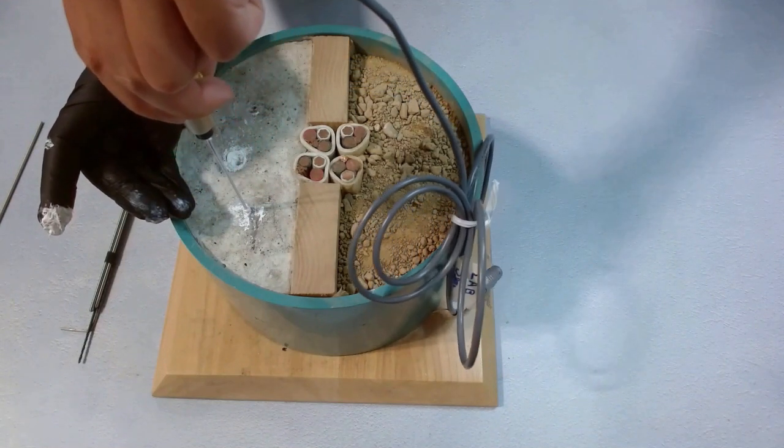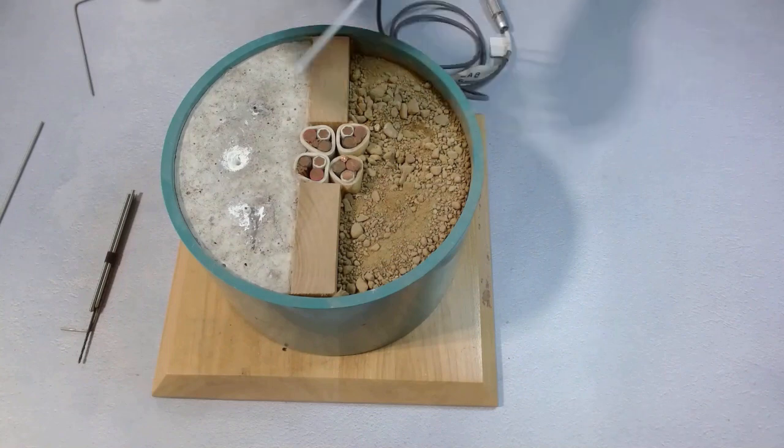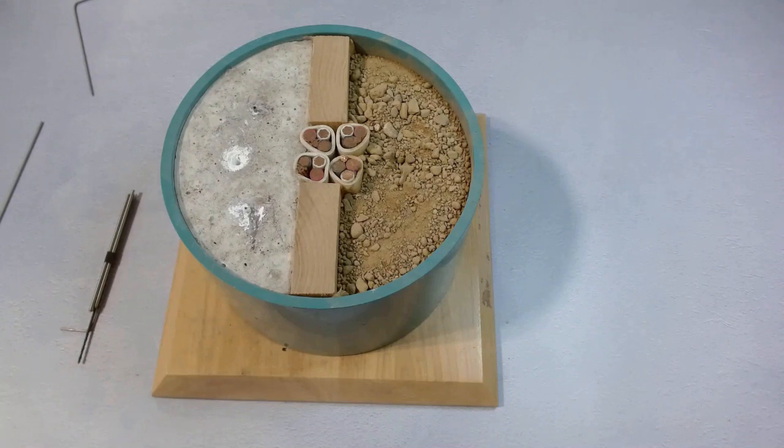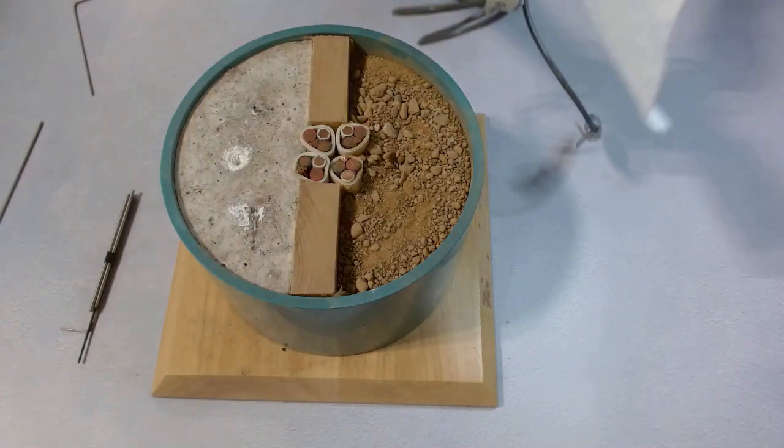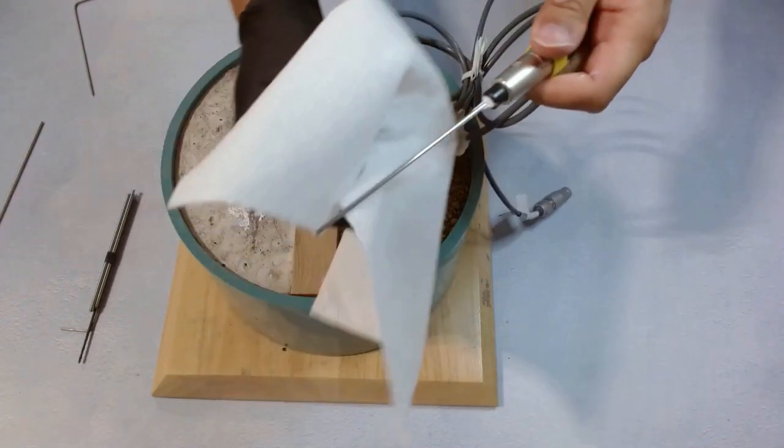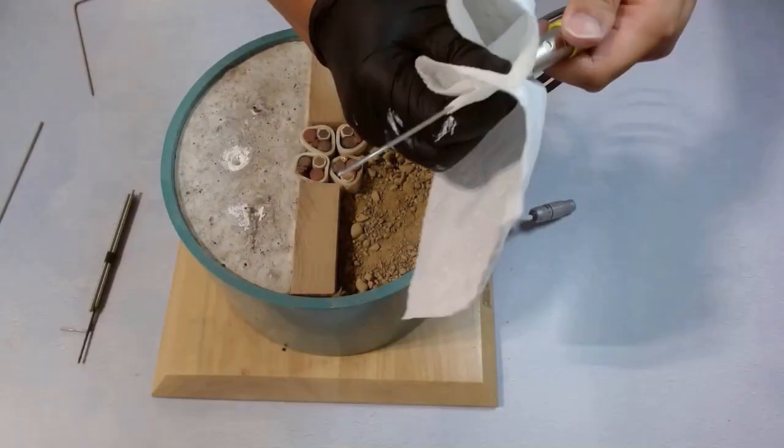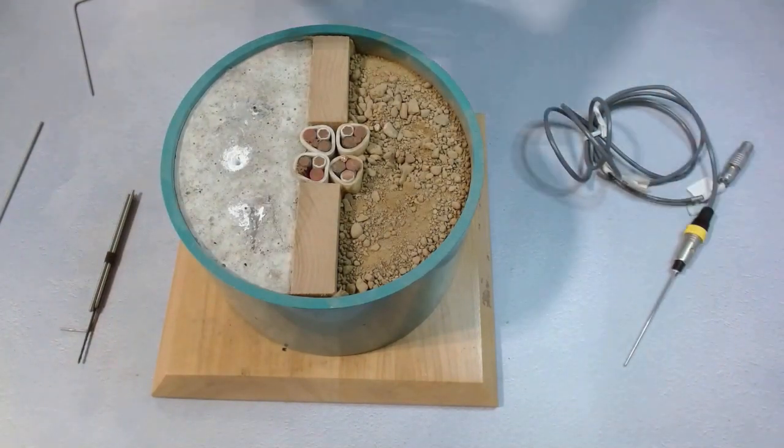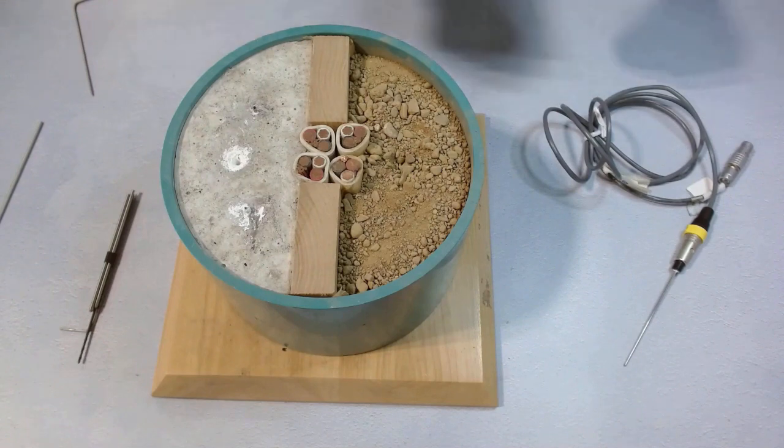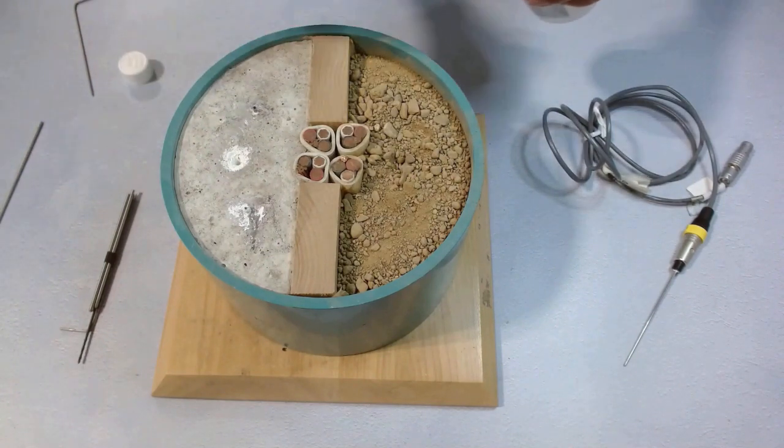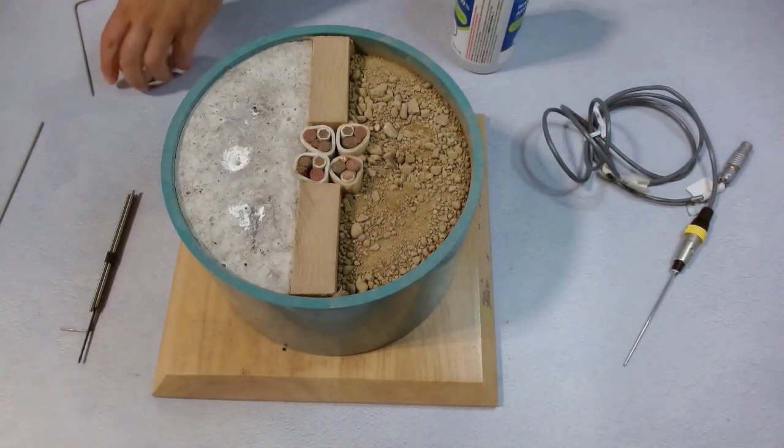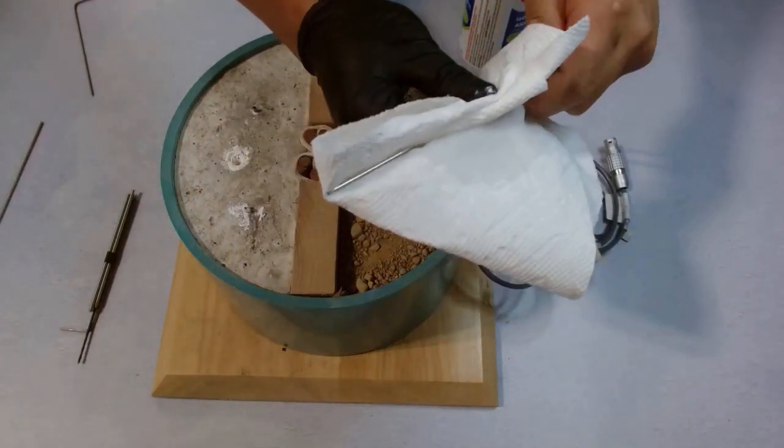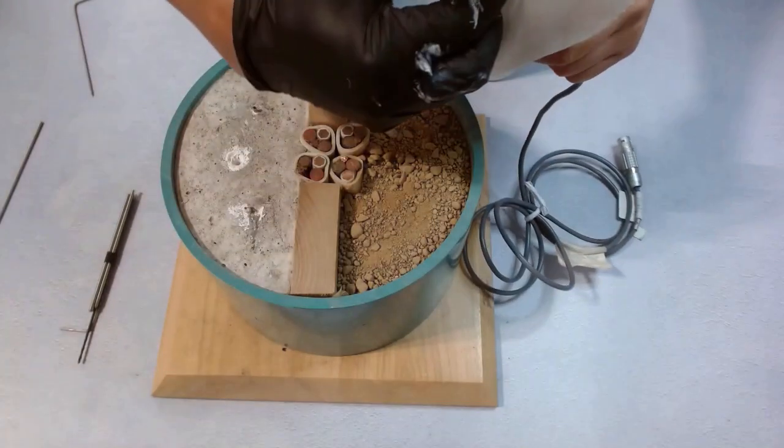After the measurement, we slowly pull the needle out. Don't bend the needle. After that, we need to grab some paper towel and clean the needle like we did before. Hold the metal handle with one hand and clean it with the other hand. If needed, we can also get a little alcohol and clean it completely.